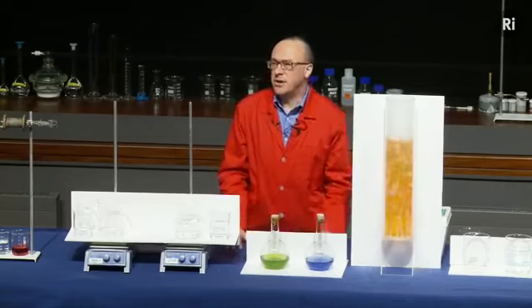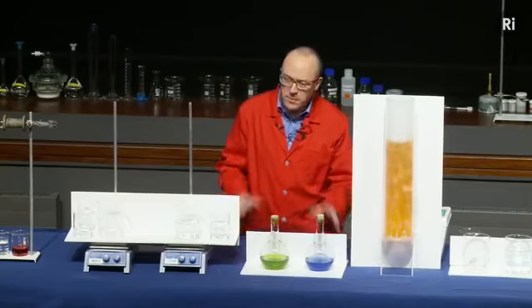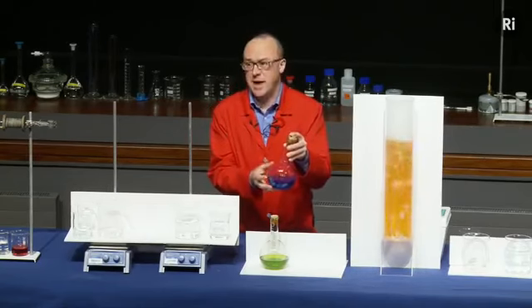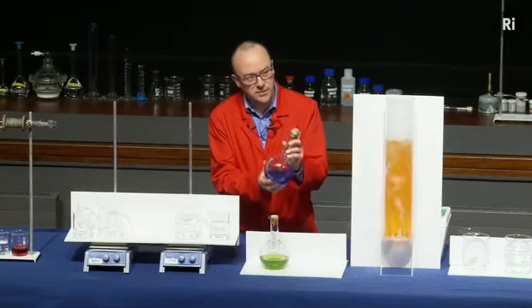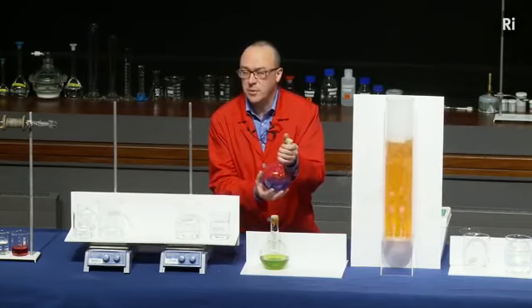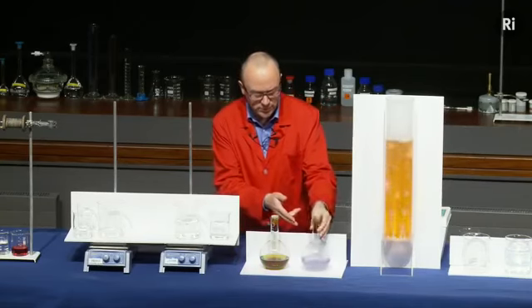But the first mystery is, why do we have a colour change at all? I didn't seem to be mixing two things together. What we have to remember, of course, is that this flask not only contains water, but it contains a gas. In fact, the gas is just air. And air, of course, is a chemical. And when I shake the flask, I'm mixing oxygen from the air with the liquid, and that's producing the chemical reaction.